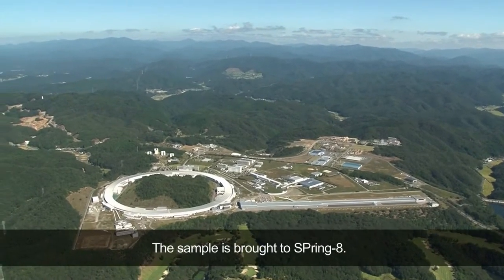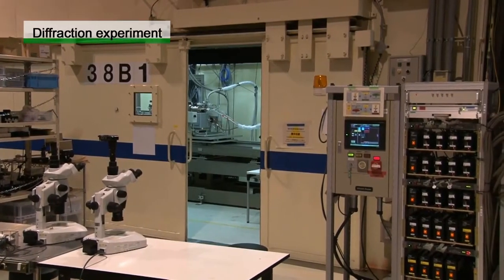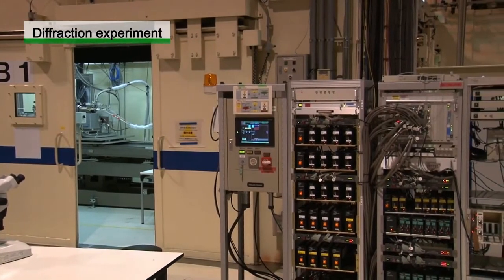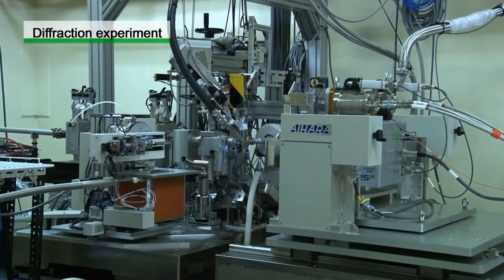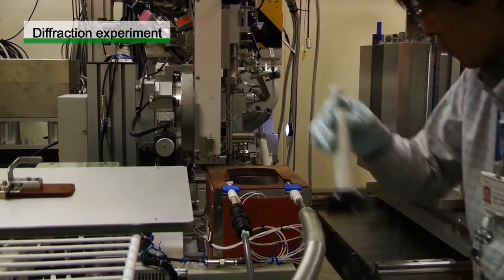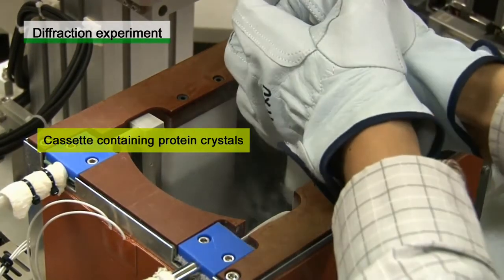Step 2. The diffraction experiment. The sample is brought to SPring-8. This is BL38B1, one of the beam lines for protein crystallography. At this beam line, data can be efficiently collected by changing samples using an automatic sample changer. The cassette containing the protein crystal is placed in the automatic sample changer.